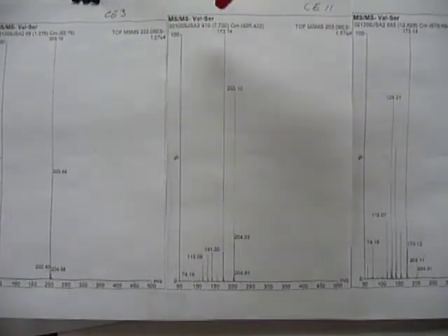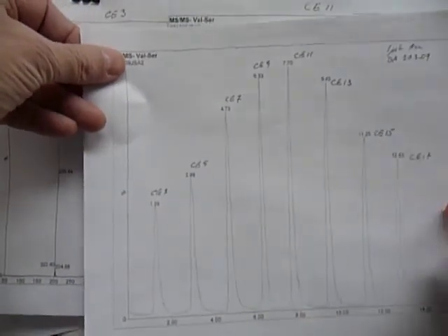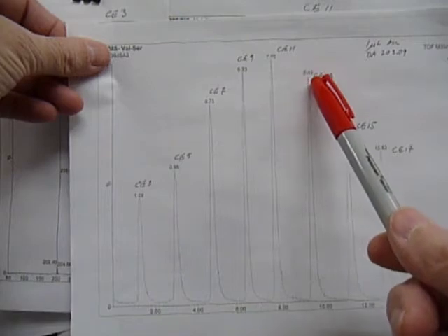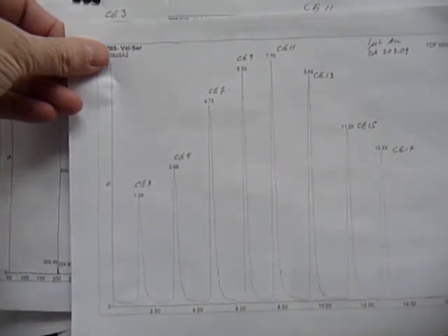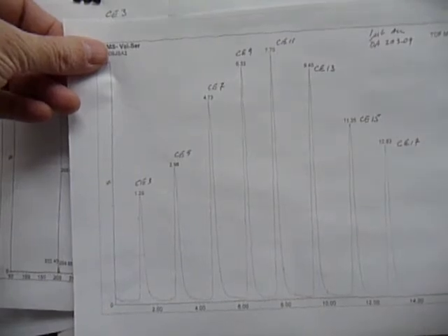So as collision energy goes up, there's a maximum, and then it starts to go down again. Let's see if this shows up well. You can see as collision energy goes up, it peaks and goes back down, because we're starting to get more scatter.